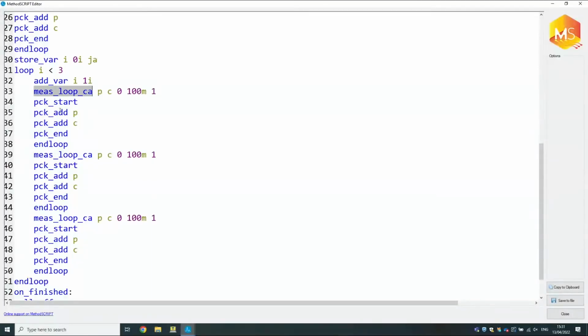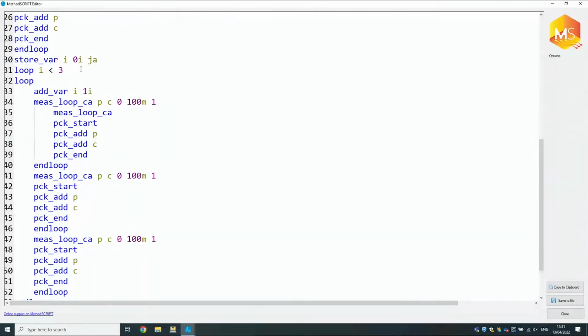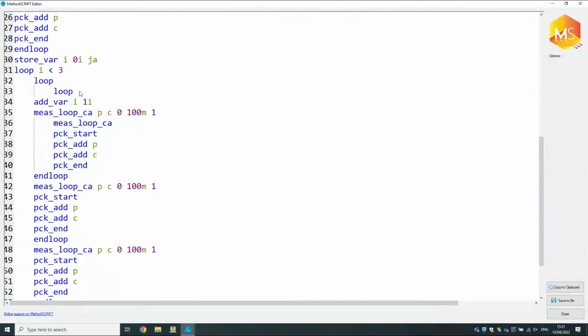Yes, in fact, it's kind of already what you're doing, because a measurement loop is also a loop. It's just you can't do 2 measurement loops in each other, so you can't say do 1 measurement loop here and then say inside of that do another one. That's not allowed. But if you use the simple loop command, you can chain them however many times you like. So I could make a loop that contains make 1 measurement 1 time and then the following one 3 times in a repeat loop, and then the whole thing is repeated.